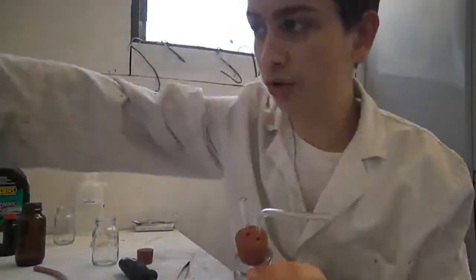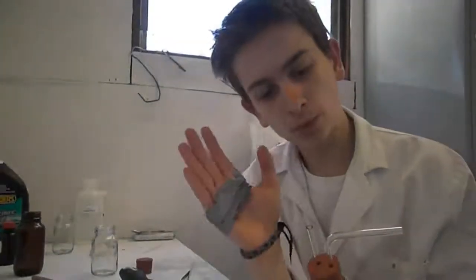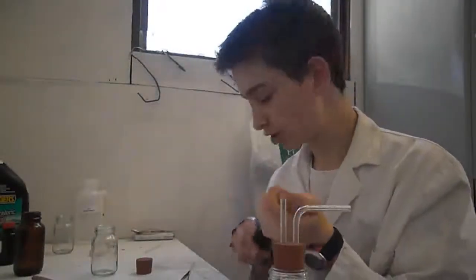I managed to drill holes into my first stopper. Hilariously, I managed to cut my hand with one of the glass rods, so that's great. I finally got them to fit. I had to change the drill bit, stuff it with this, and then this came out, and, you know, it's just amazing. It's just a great experience. I'll do the next one. Hopefully I don't slice my face off.